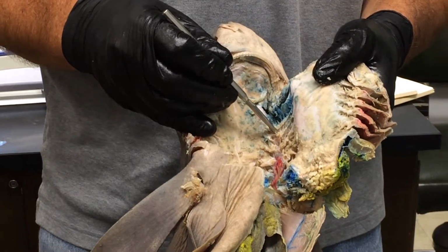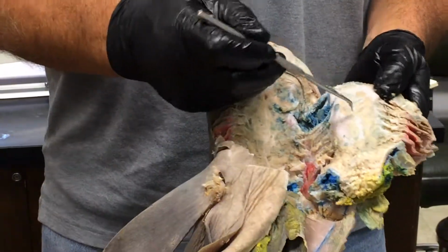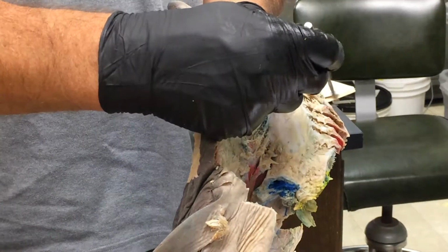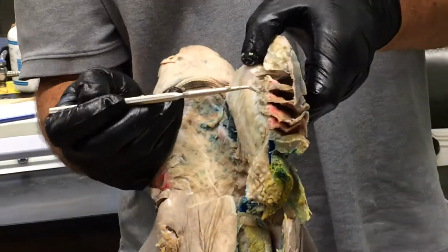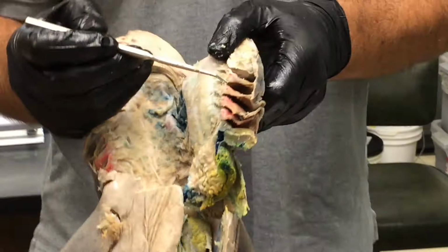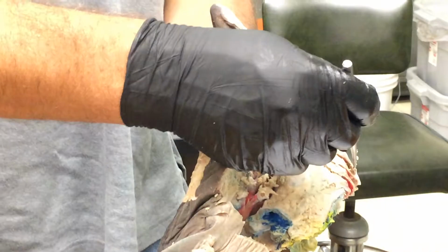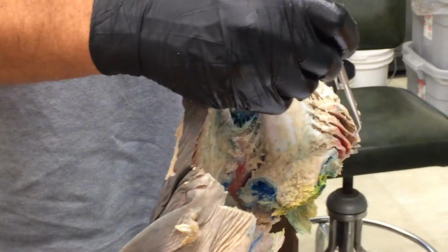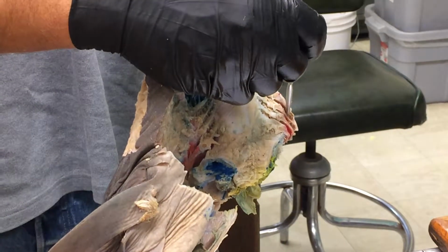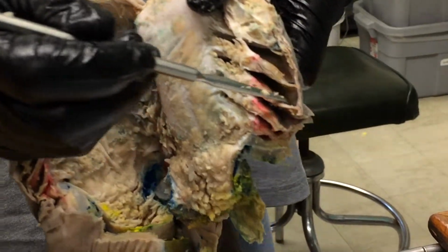Branchial pouch. Okay, so the branchial pouch is this whole space that's been opened up by cutting open the pharyngeal wall. That's one branchial pouch. This is another branchial pouch. Here, branchial pouch, another branchial pouch. Okay. And if we look within the branchial pouch, you can see the gills and the gill lamellae there. And then there's a region that has no lamellae that's out to the side, and that space has a special name. That's the parabranchial chamber, this area that's outside of where the gills are. You see that?